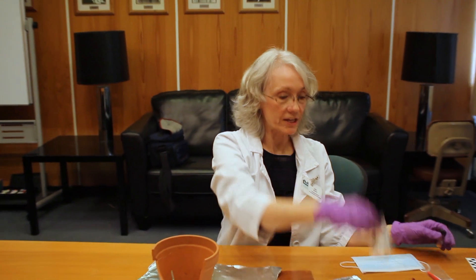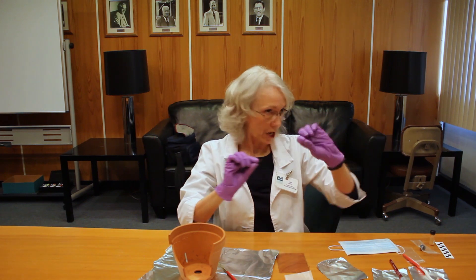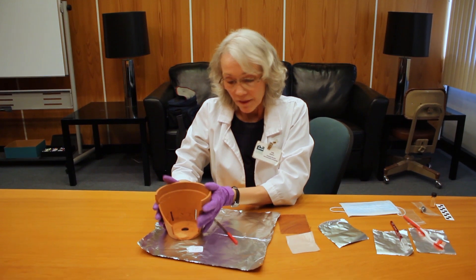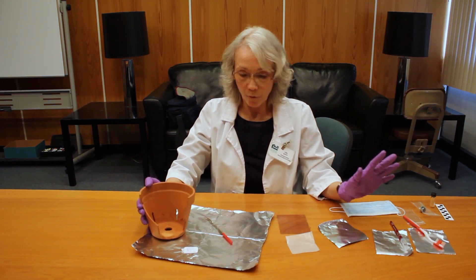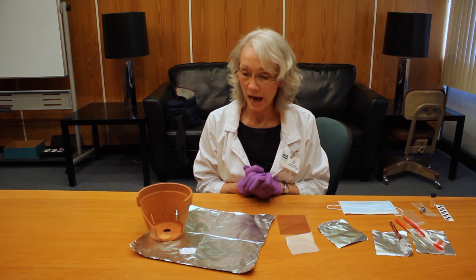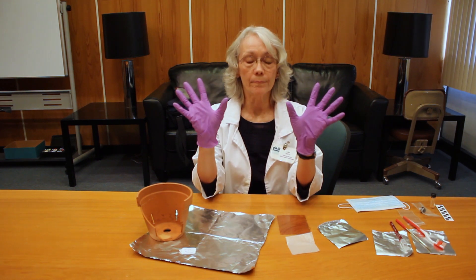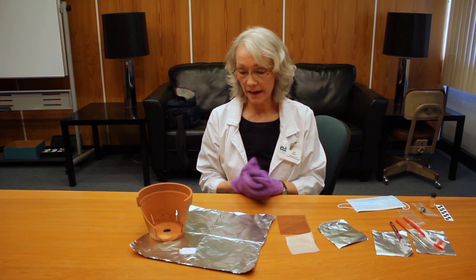When you're done and your sample is sealed, labeled, and documented in a spreadsheet, your pot can go back. Throw away all the foil you've used, set aside all your tools, re-wipe down the surface with a damp paper towel, and then start over again for your next sample. You can reuse your mask, but use a fresh set of gloves for every single item that you're sampling, and a fresh work surface.